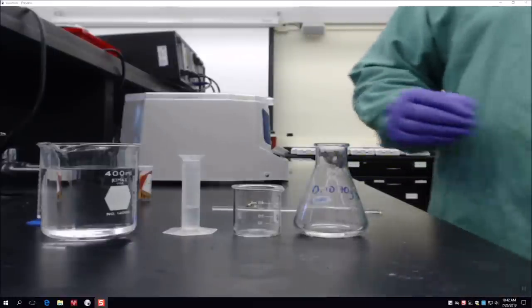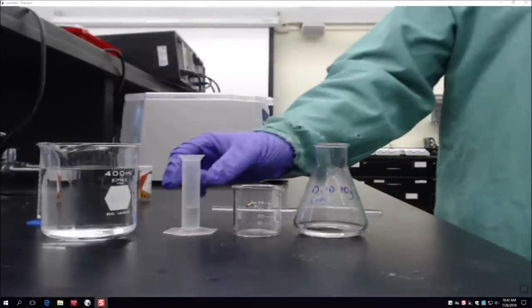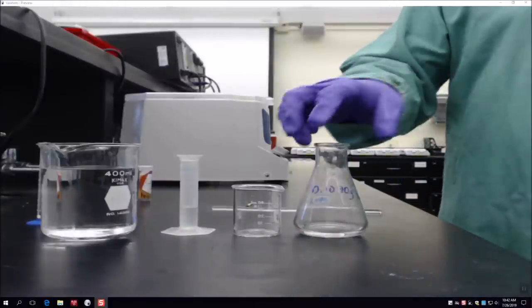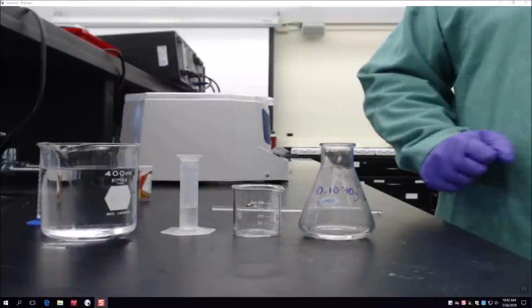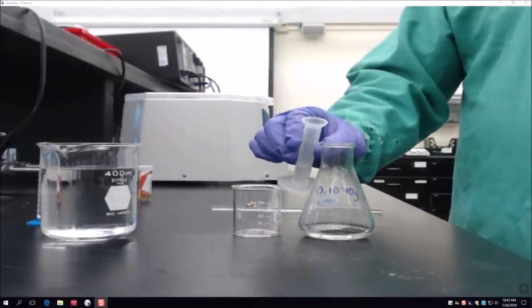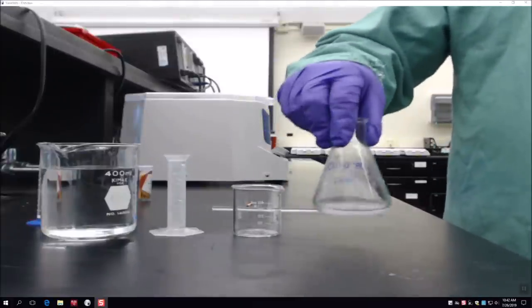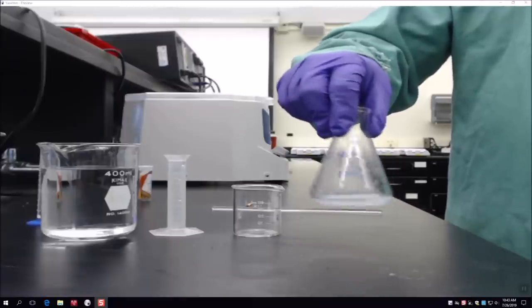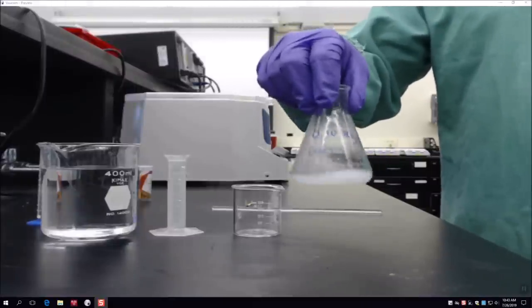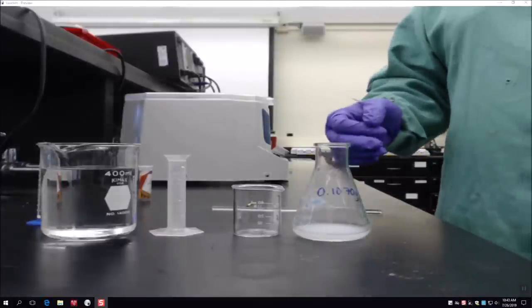I'm going to show you the reaction between sodium hydroxide and our previously formed magnesium chloride solution. I've already measured 3.5 mL of 5 molar NaOH into a graduated cylinder, and in this flask we already have dissolved magnesium chloride. I'm going to pour the sodium hydroxide directly into the flask and give it a stir. You can see it got cloudy — that cloudiness is the precipitate forming. That's our magnesium hydroxide, which as Colin explained is insoluble in solution.